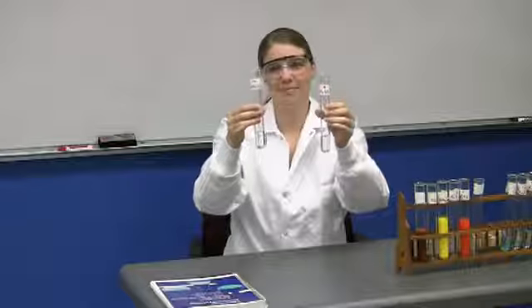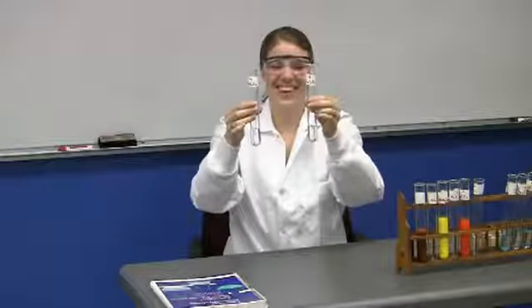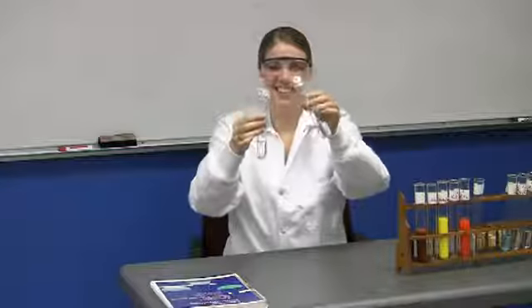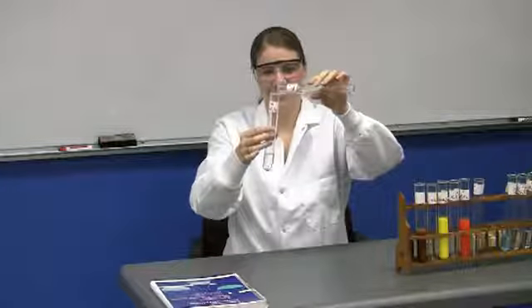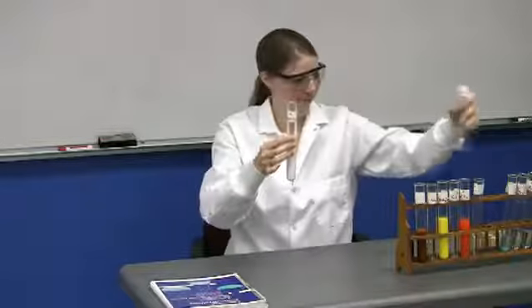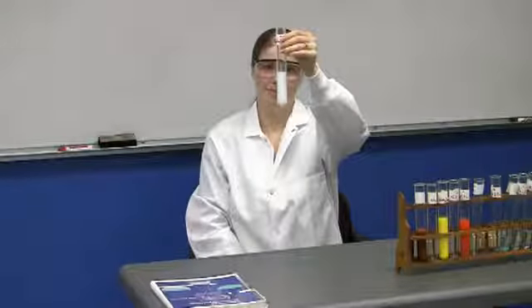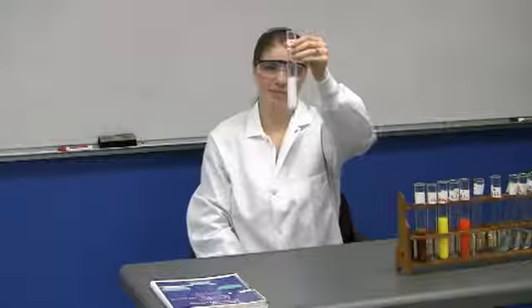Here we have barium chloride on the, whoops, I gave away the name. BaCl2 on the left and Na2SO4 on the right. And go ahead and mix them. This is not nearly as pretty, but it's still a solid produced. Just as an FYI, this solid is used as a weighting agent in drilling fluids used to drill oil and gas wells. Okay, so that was white.